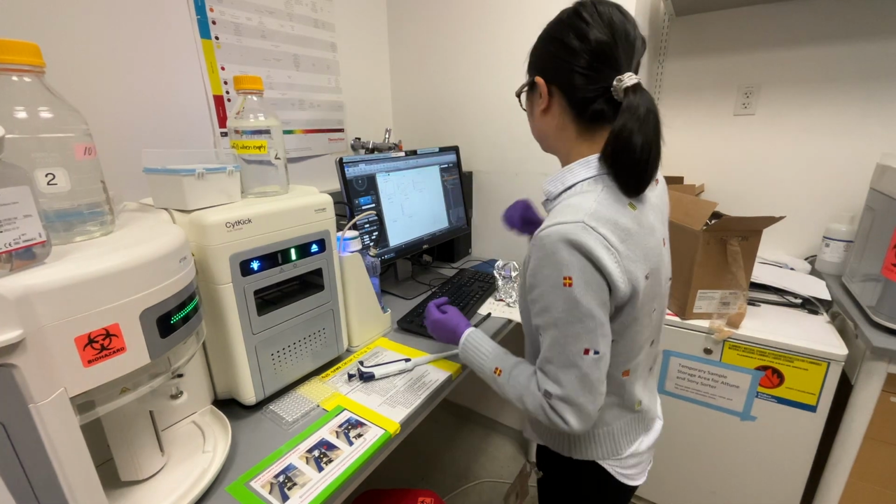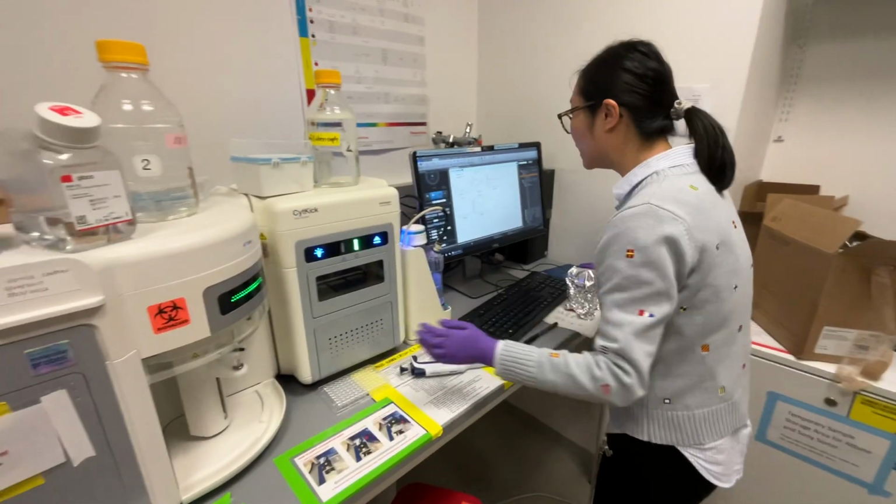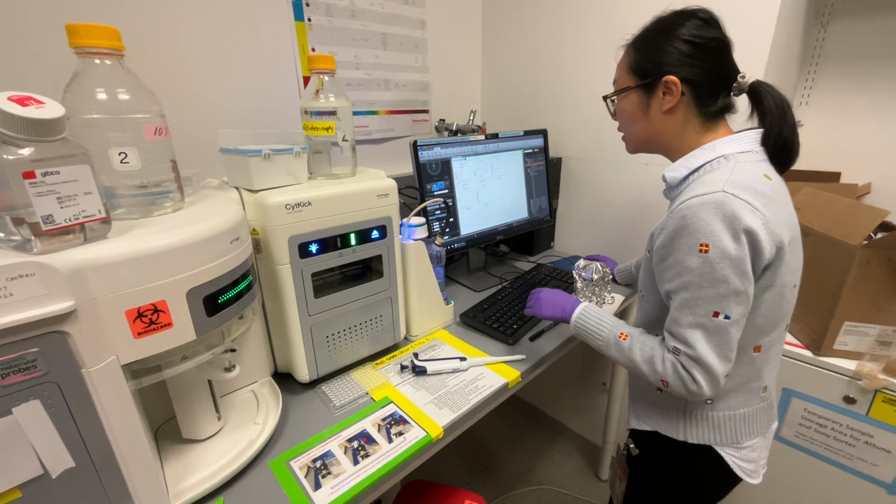I'm just running some buffer through it so that I have the line all cleared.